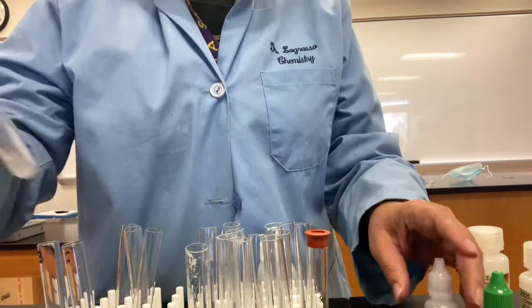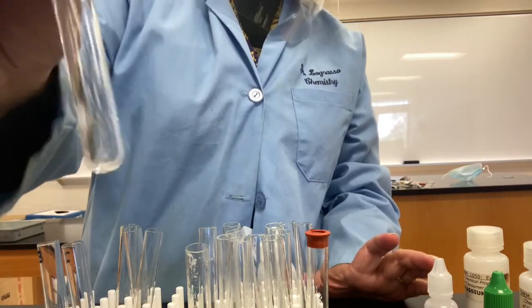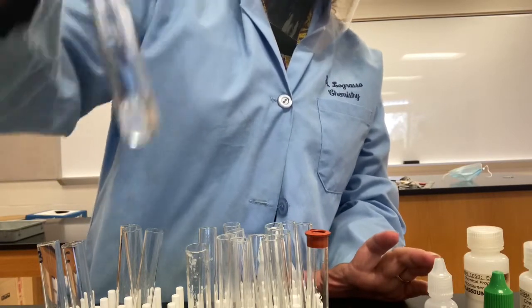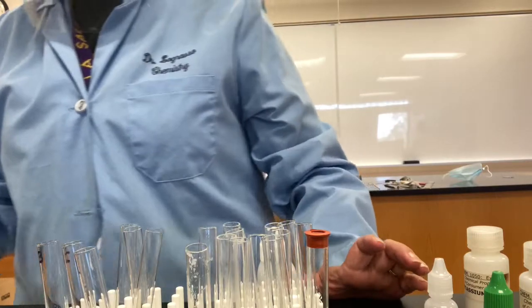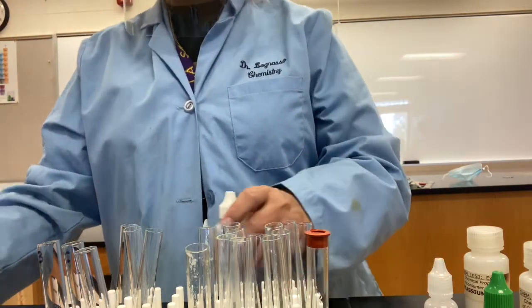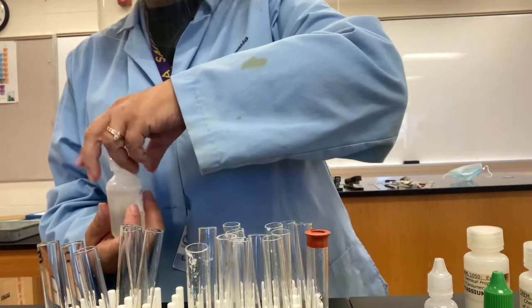I'm going to dissolve it up. Shake, shake, shake, shake. Yeah, that's pretty dissolved, right? That's pretty good. All right, now next, it's a little bit tricky. We're going to add our bleach. So it says to add 1 milliliter of bleach, so that's 20 drops.